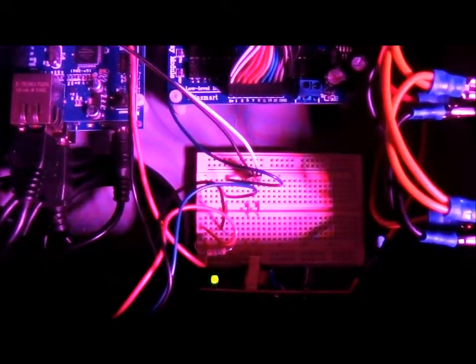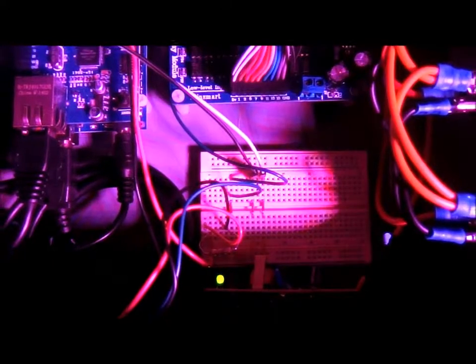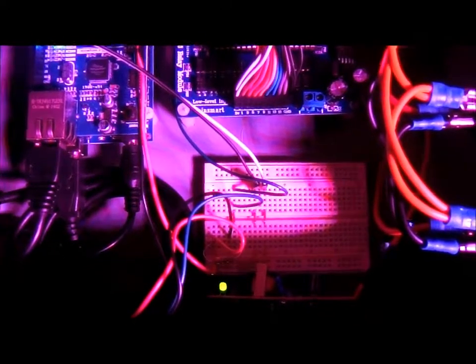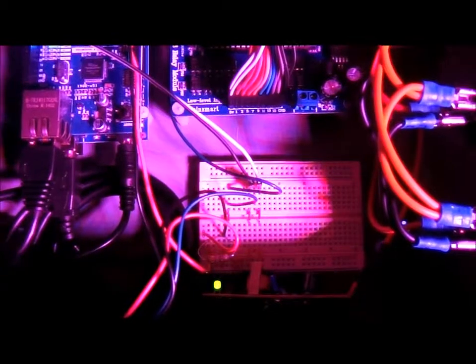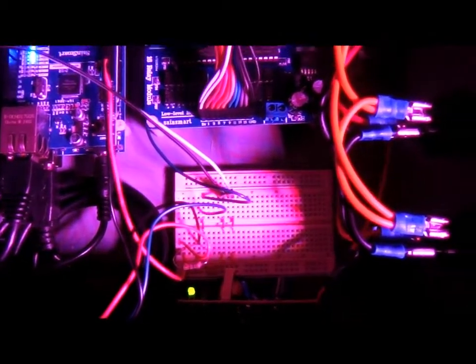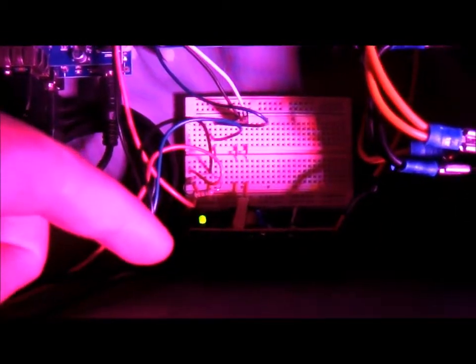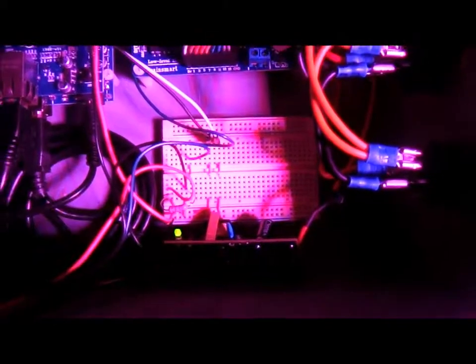There's a breadboard right now. It'll eventually be replaced by a prototype board. Right now it's doing its job though, so there's just a little bit of sticky right there to hold it in place. And this board right here, this is the Arduino's power converter. It goes from AC to a 9 volt DC, and that comes with the unit.